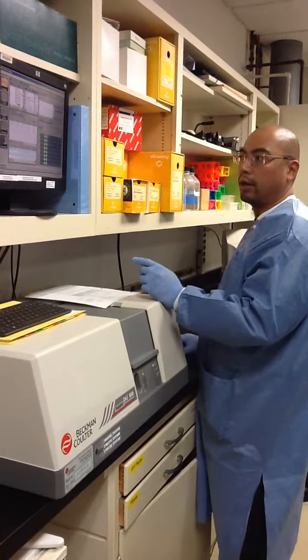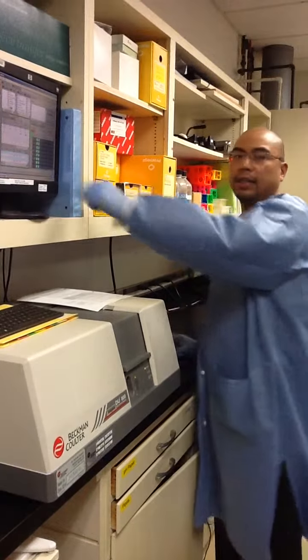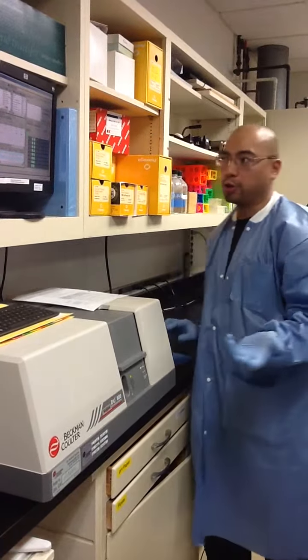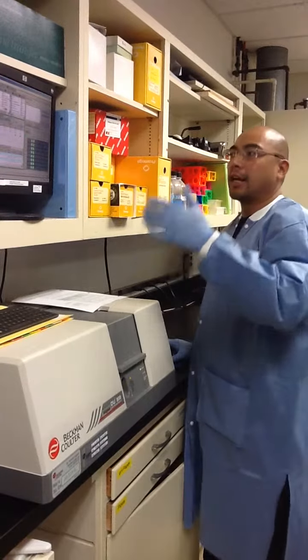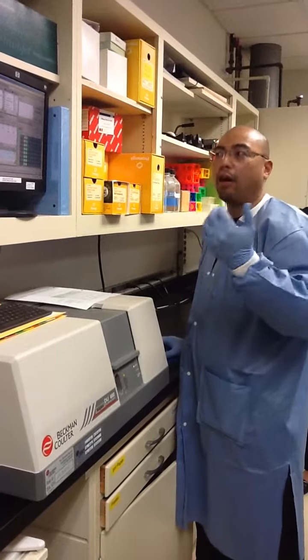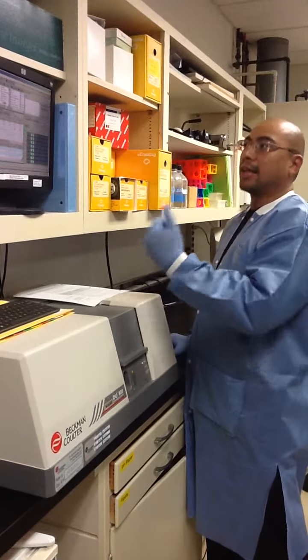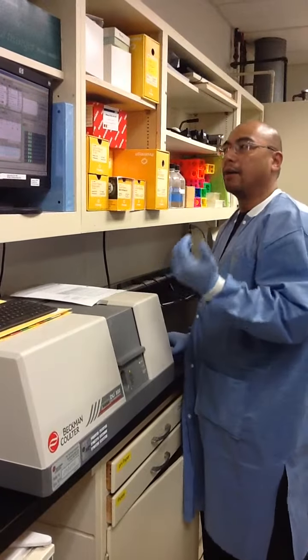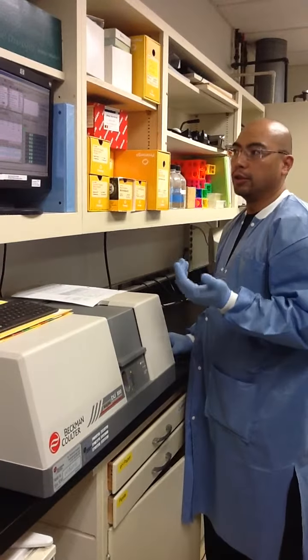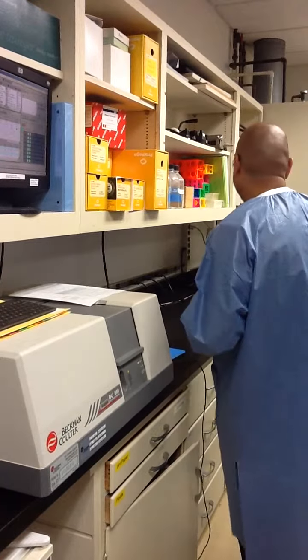What ours allows us to do is detect the sample in the strip tubes, and then I can designate what's what in each sample. So 1, 2, 3, 4, 5, 6, 7, 8, all the way through 14, and the last two I'm using as controls. As the data comes up, it'll label it for sample 1, 2, 3, 4, and you can get all your data based on your number. We can set the plate type, the amount and the volume. One of the things I have programmed in here is a melting curve.